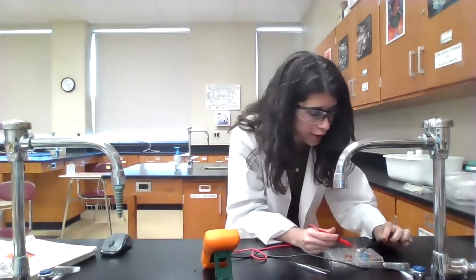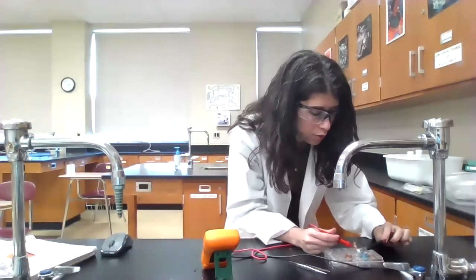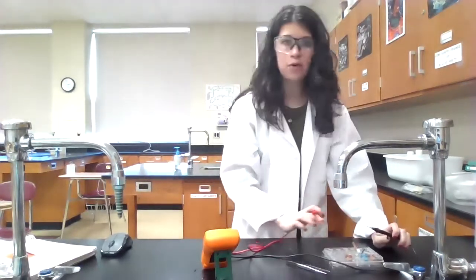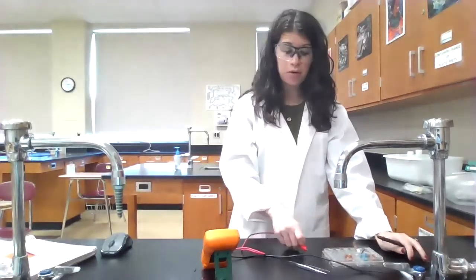And so now I'm getting a voltage. It's lower than what I got before. Remember, before when they were both 1 molar, I got values around 0.99, 0.98. Now I'm getting a voltage reading of around 0.88. So the voltage did go down, which makes sense because I did dilute the copper(II) nitrate solution. And so I do see my cell potential go down.